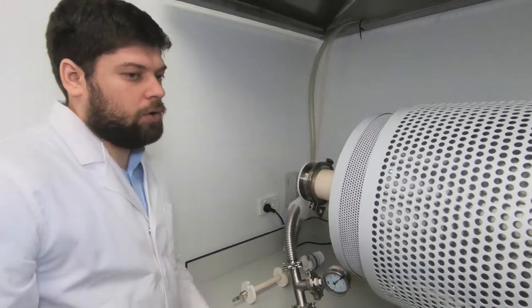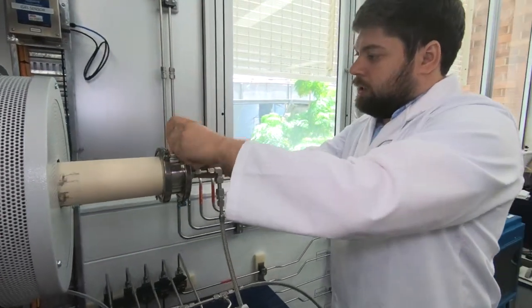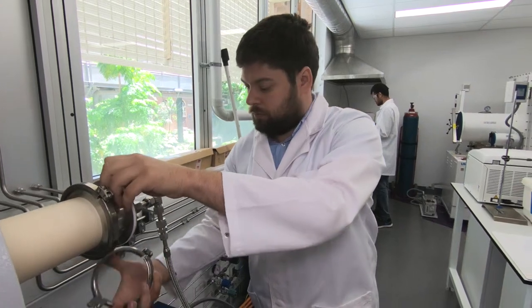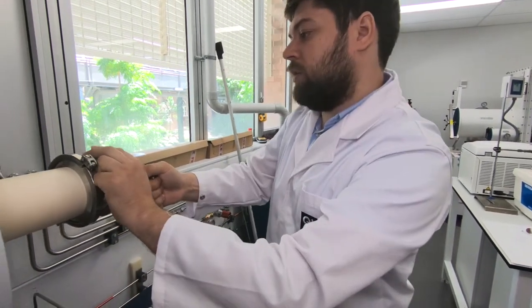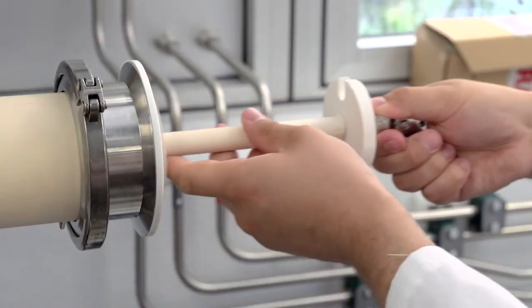Now we can open the second part. Again, unscrew, taking off the end seal, and second radiation shield.